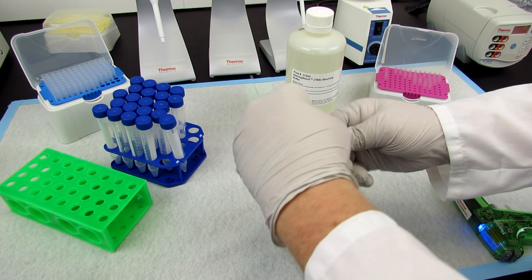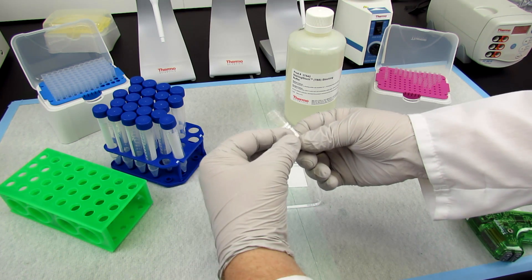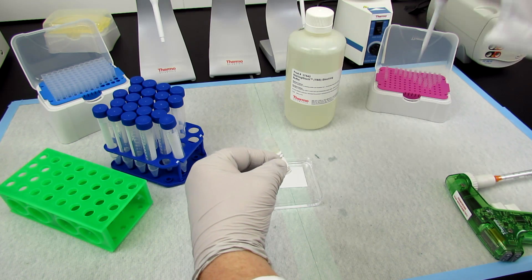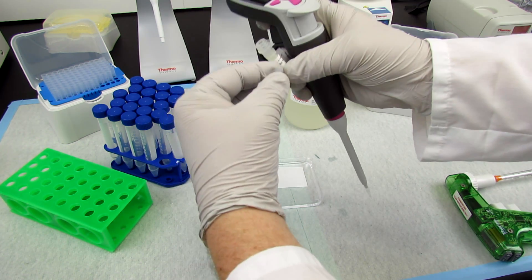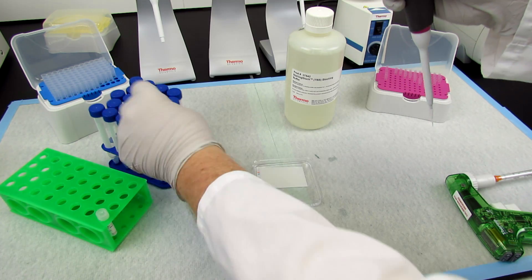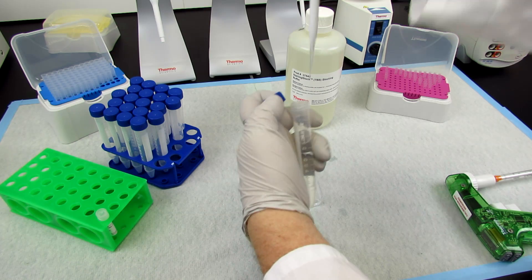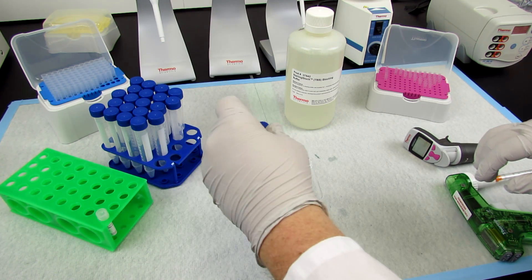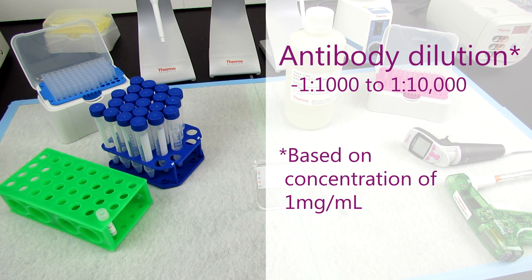To probe for your target protein, first dilute the primary antibody in dilution buffer, which is often the blocking buffer used in the previous blocking step. The exact antibody dilution and buffer will need to be empirically determined. Typical suggested dilutions for most commercial primary antibody stocks, often provided at a concentration of one milligram per milliliter, range from one to one thousand to one to ten thousand.